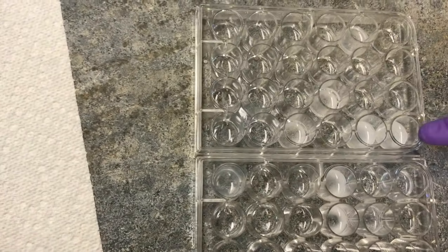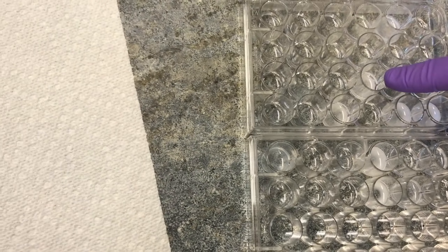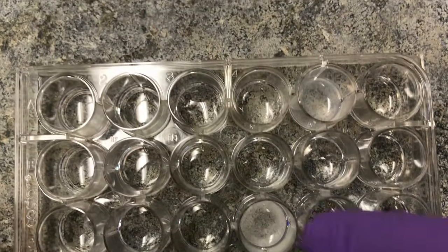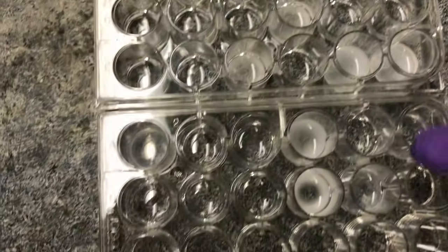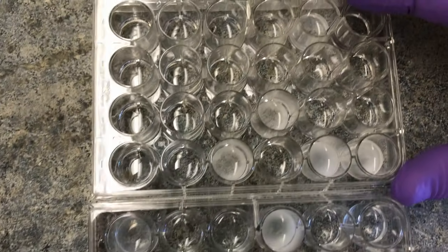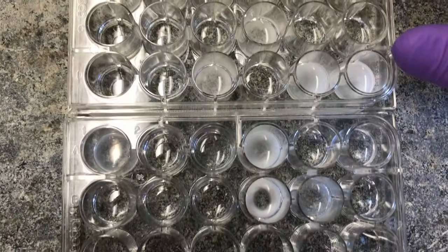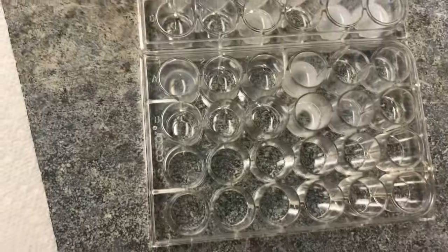So there are some where, say, these look pretty milky white over here. These you can see more distinct pieces. You can see more distinct pieces here. You can see the bottom. This one is very pale. Like I said, these are milky. So you'll want to record and be as observant as you can. Is it very white? Is it kind of pale, but you can still see that there is a precipitate that fell out of solution, etc. So that's what we'll do.